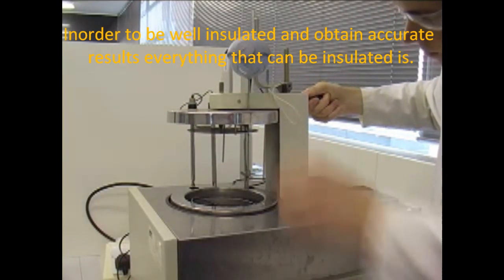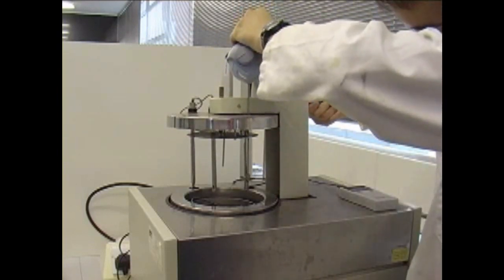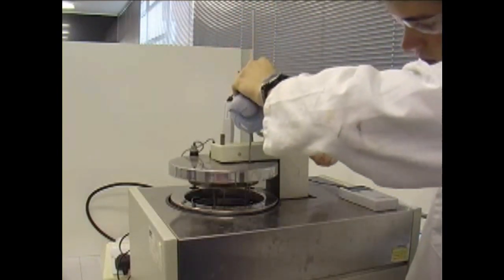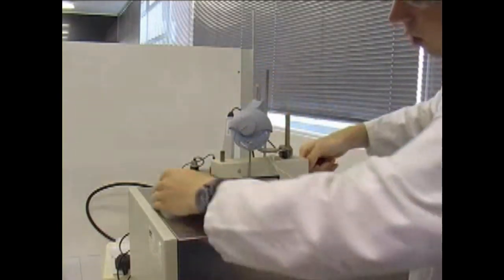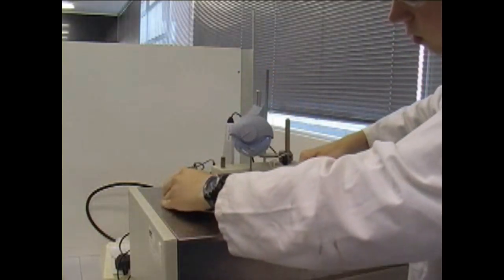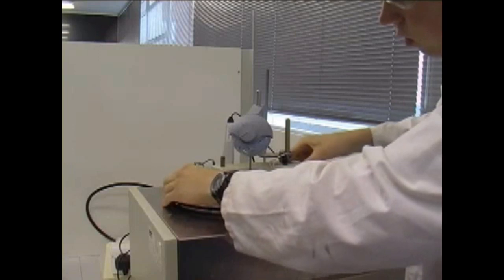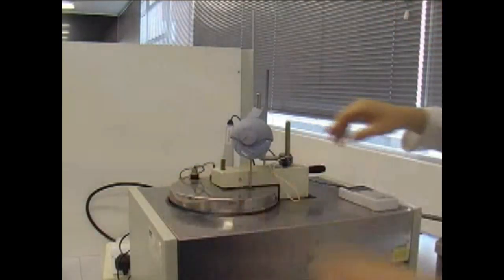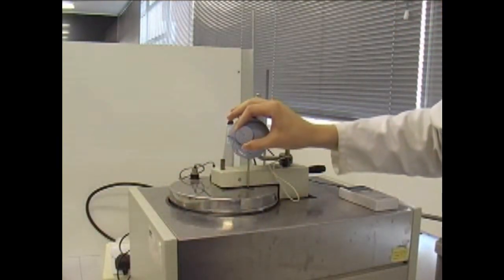The stirrer turned on, and the black button at the centre of the calorimeter pushed down. If a good contact is made, it will stay down once pressed.